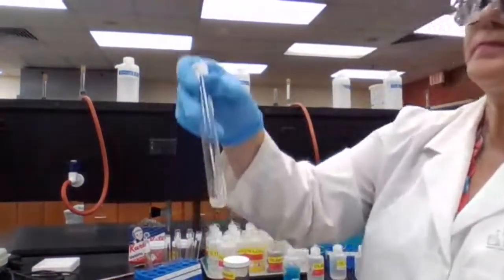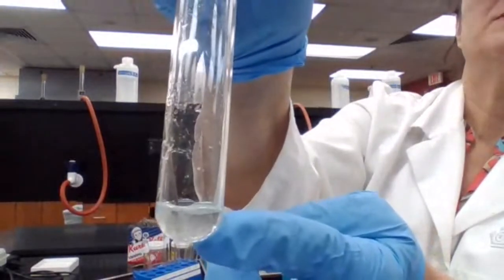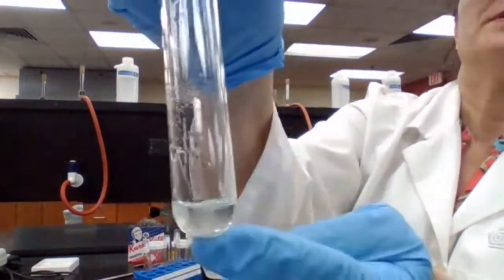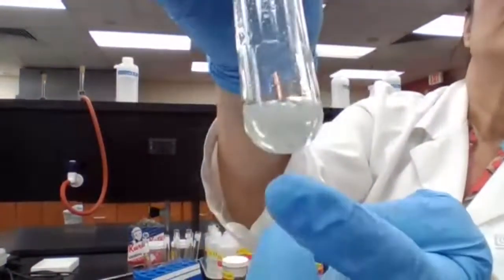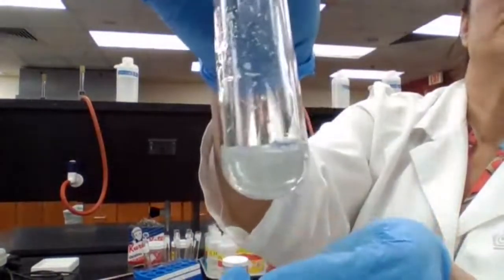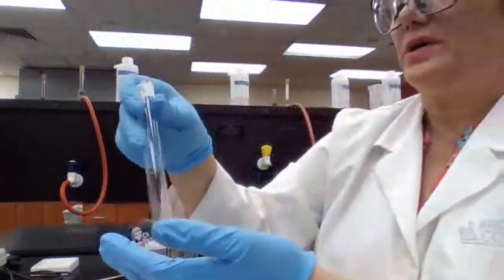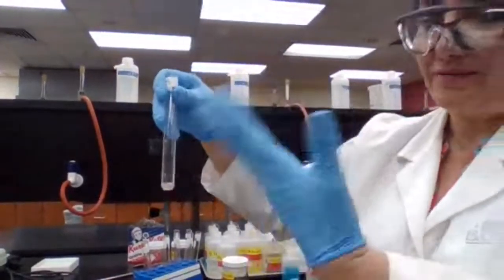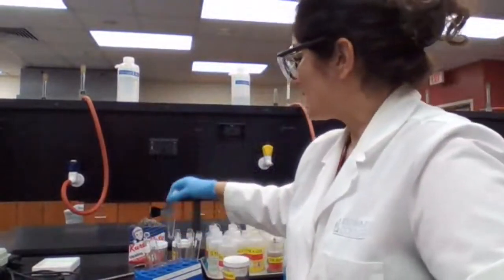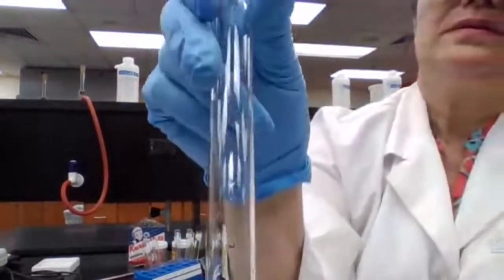For test tube B, see what happens — silver particles are coming out, copper is going in, and the solution changed color. We see gray or silver colored particles coming out, so there is a reaction here. The metal ion was silver and the metal added was copper. Copper gave electrons to silver.